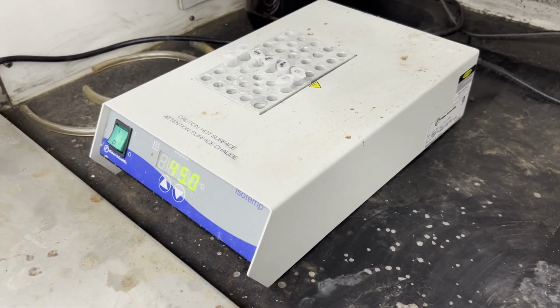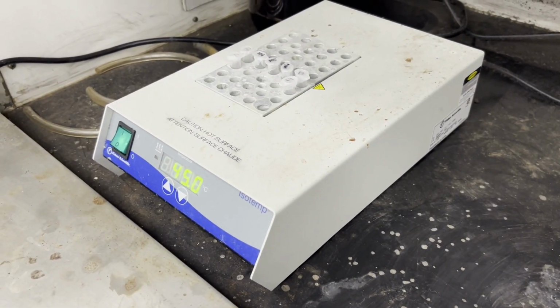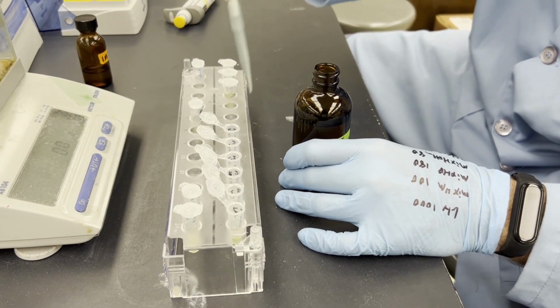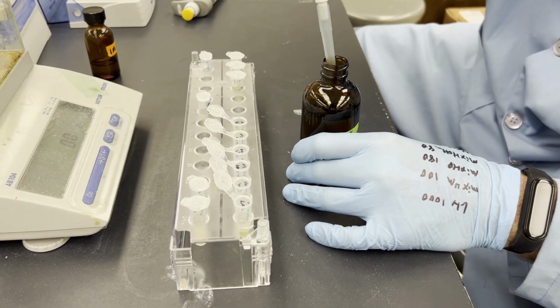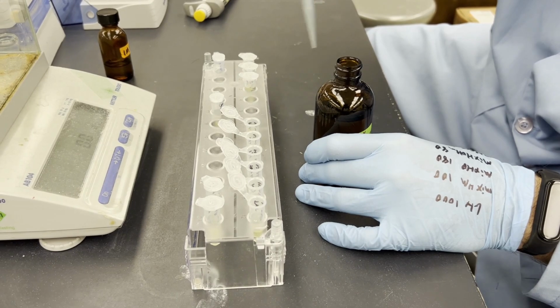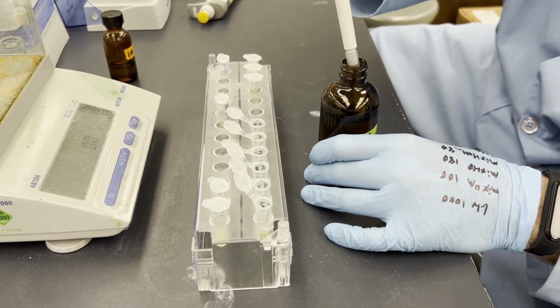Given the chiral nature of amino acids and peptides in biological systems, there are various reasons why separation of differing chiral compounds can be necessary. Whether for pharmacological, industrial, or analytical purposes, HPLC can be an effective method for separating these compounds.